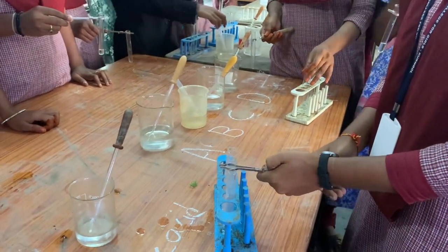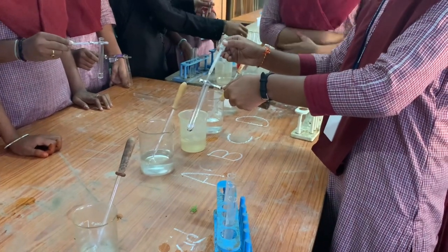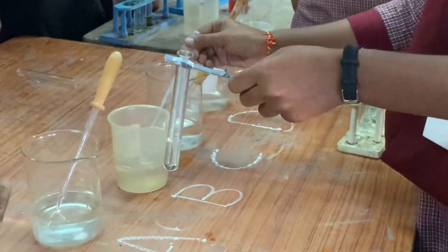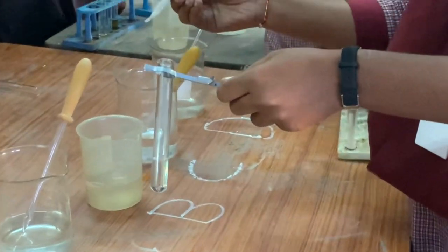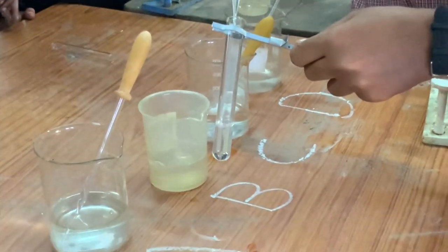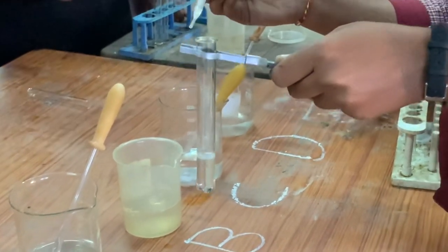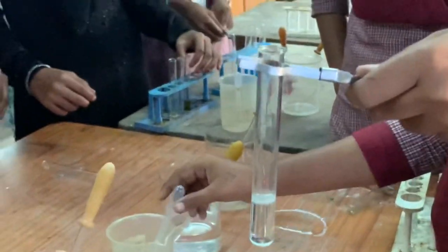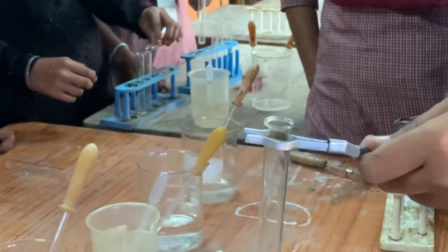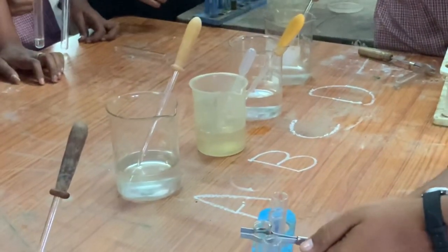Now take the 2nd test tube and add sample B slowly, so that the ring will be formed neatly. Add only a few drops of the sample. The ring is formed between the acid and the solution — a white ring is formed — which confirms the presence of albumin in sample B.